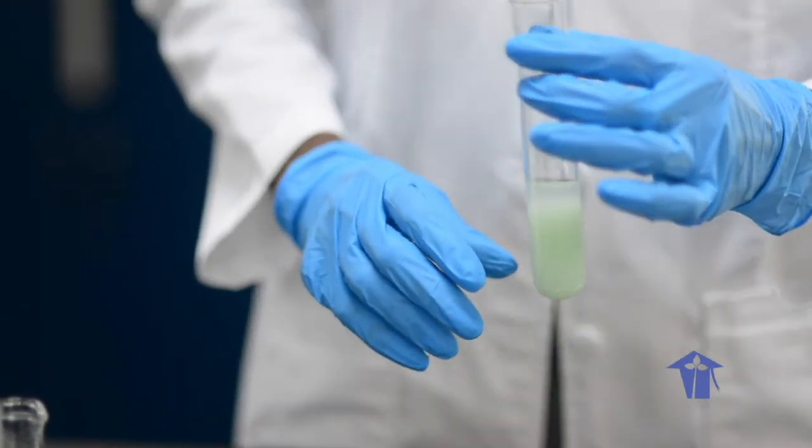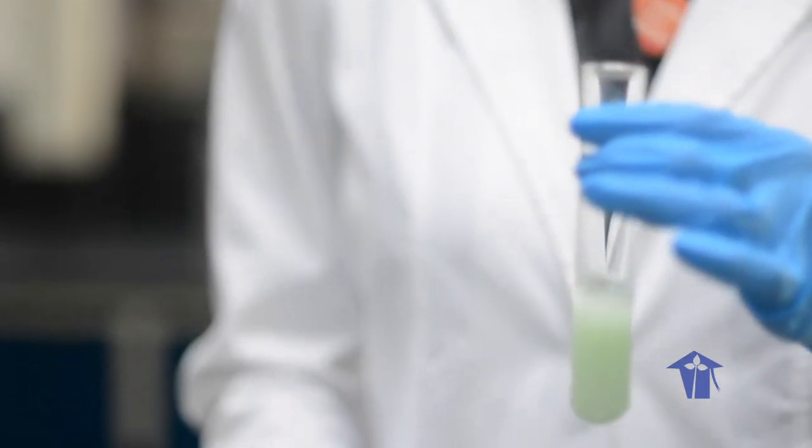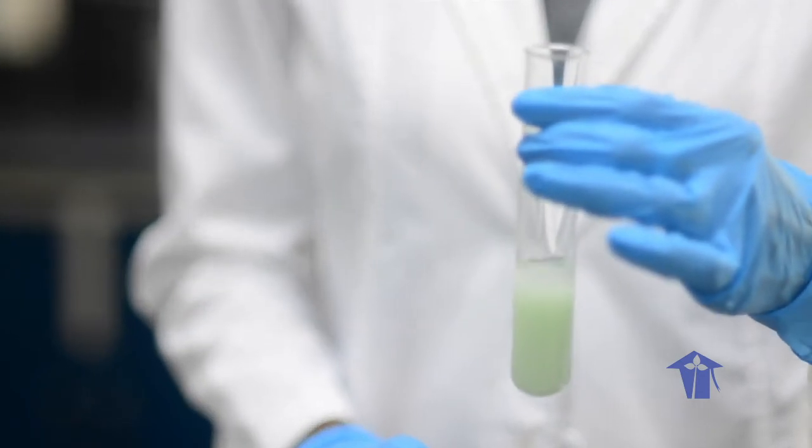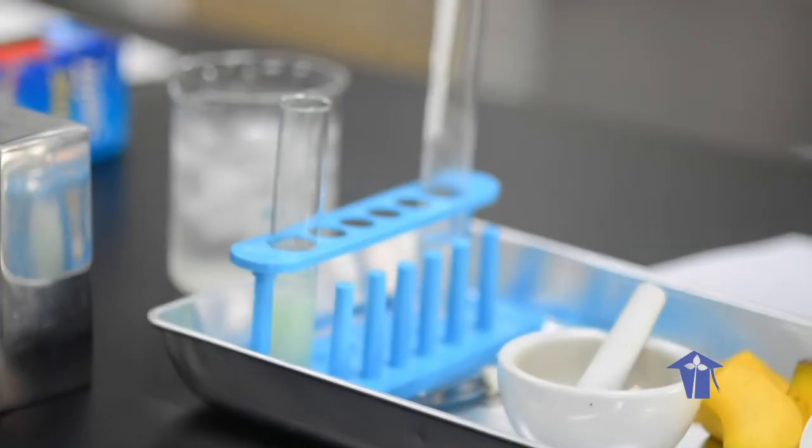So now, this mixture is going to be set aside for 10 minutes. We start the clock for 10 minutes.